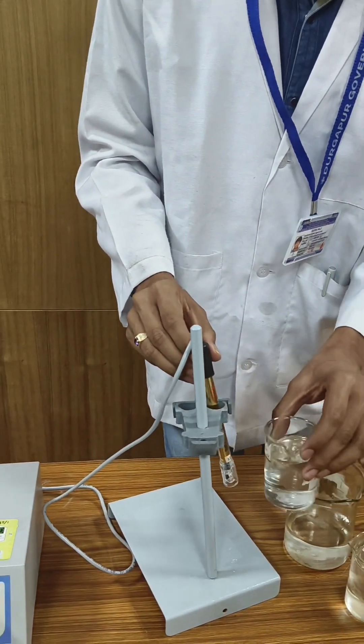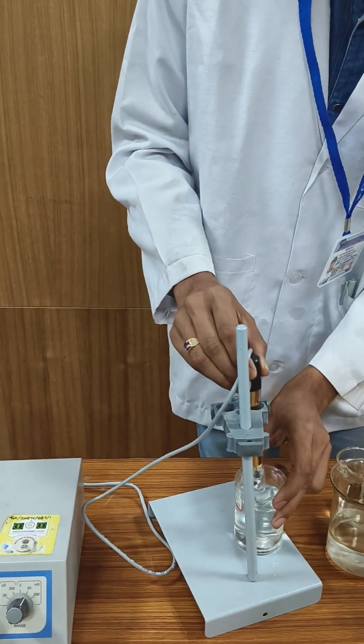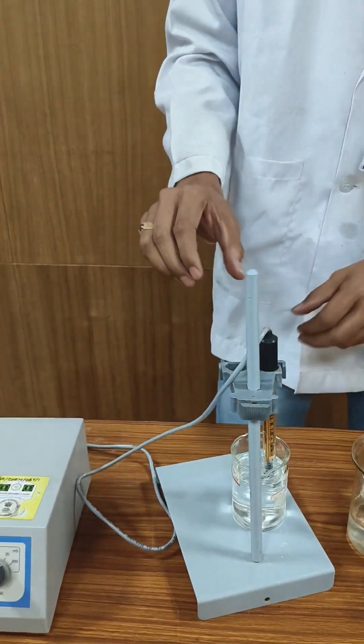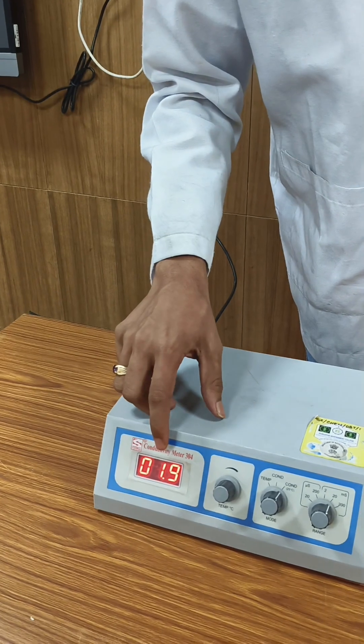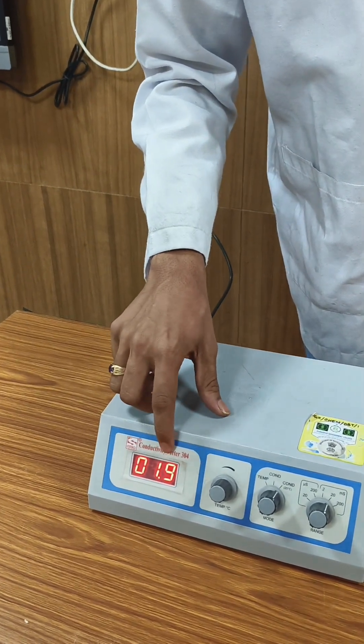Similarly, we take a second water sample and measure the conductivity. The conductivity is 1.9 microsiemens.